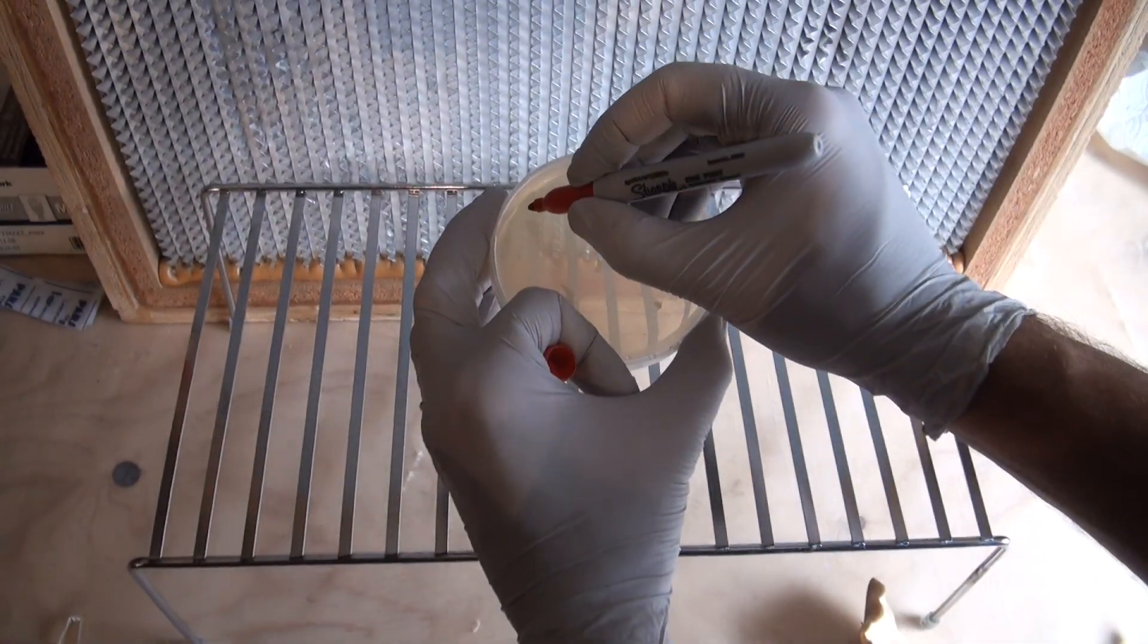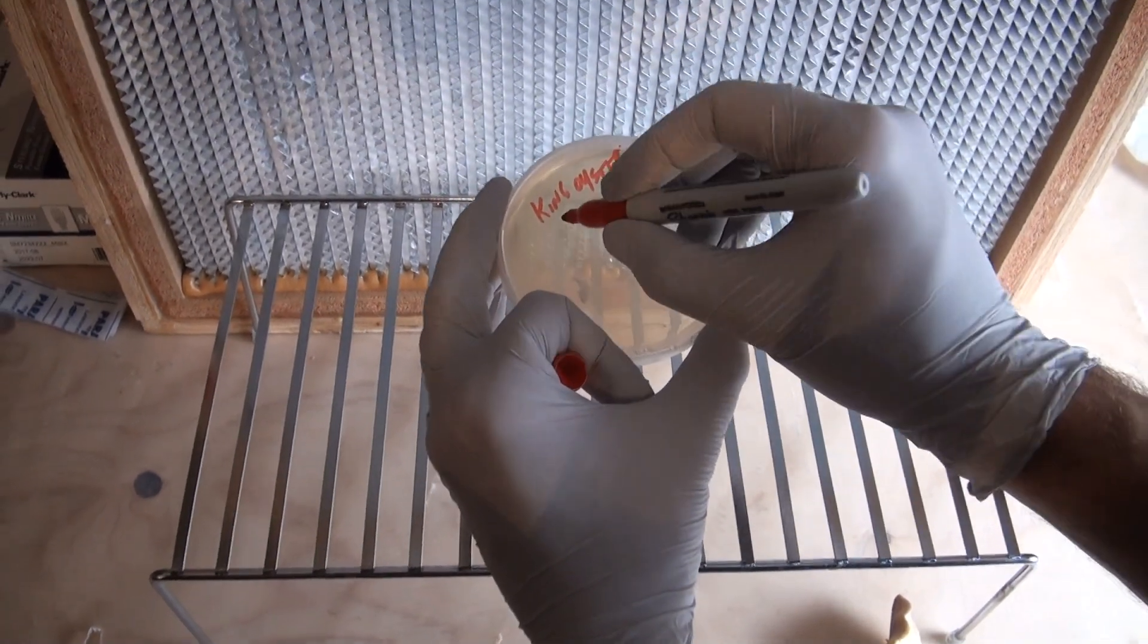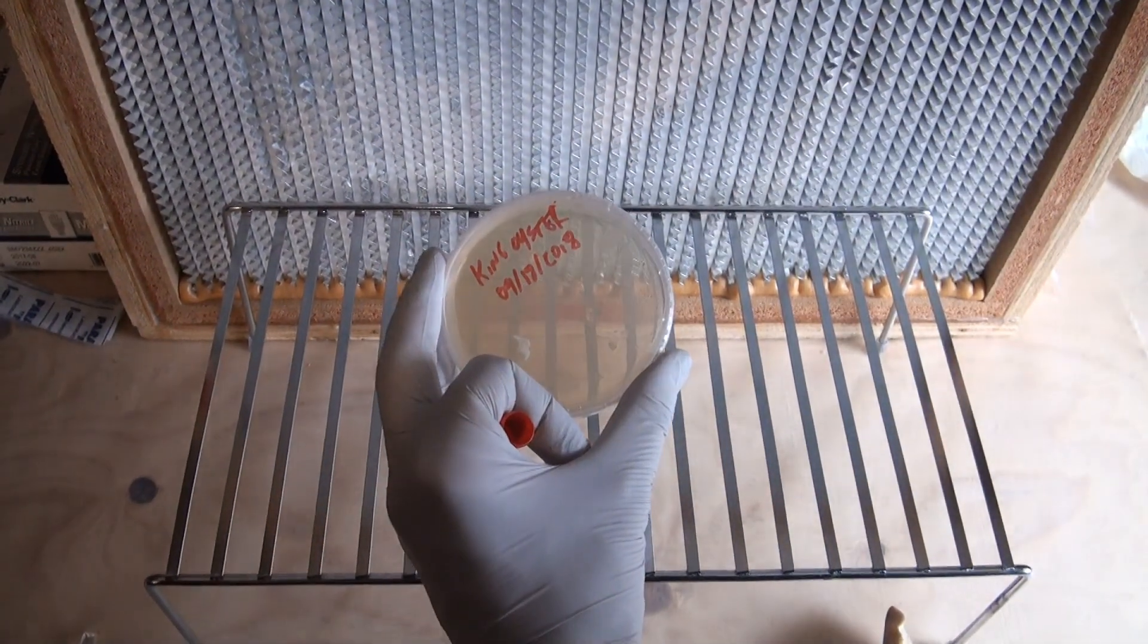So now of course I'm going to label the plate. Now we wait.